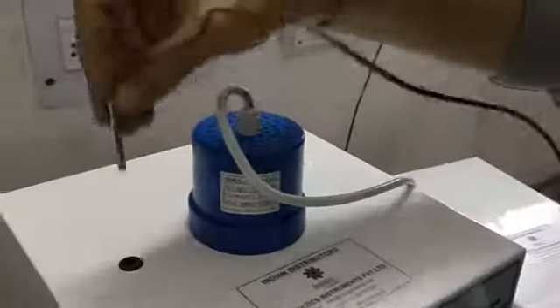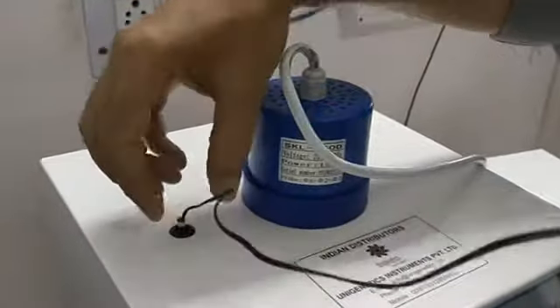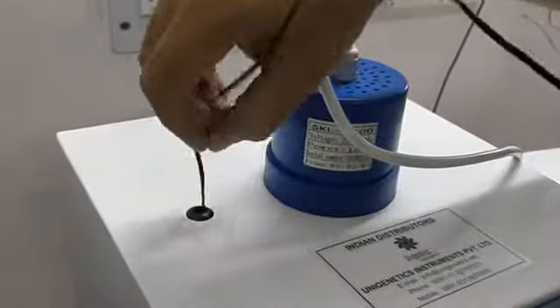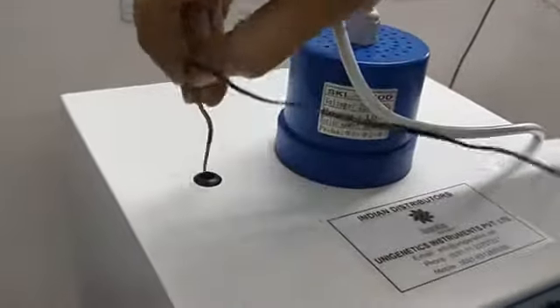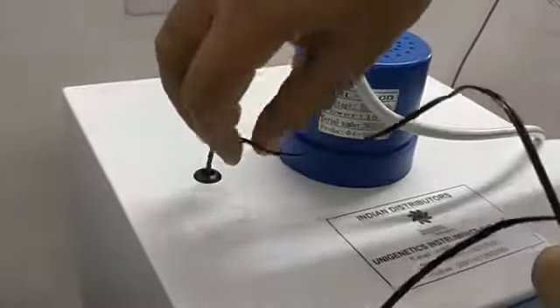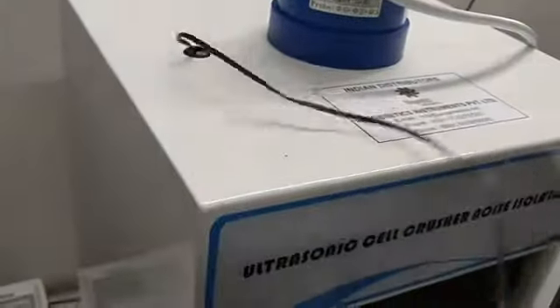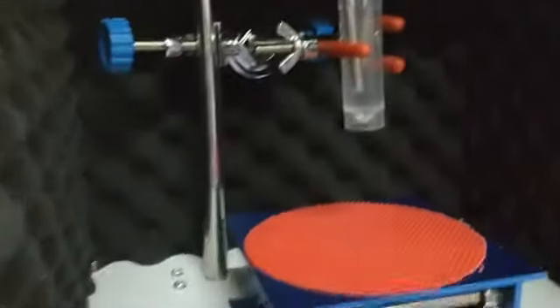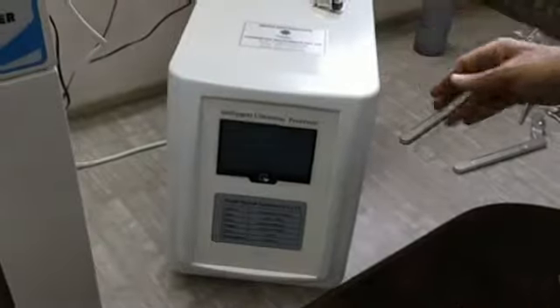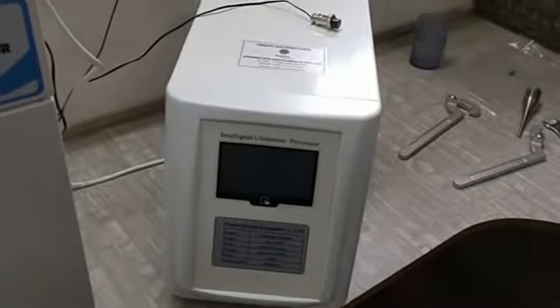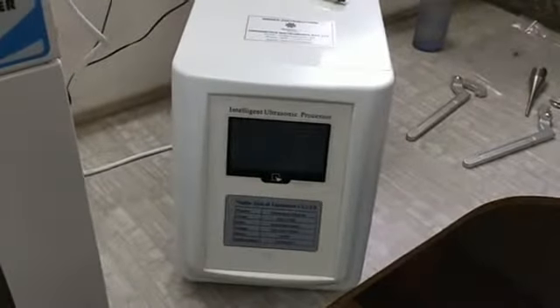I am just going to show this is your temperature sensor. It's very easy. We just have to slide it from this opening. We have to dip it in the same vial, like this you can dip it.